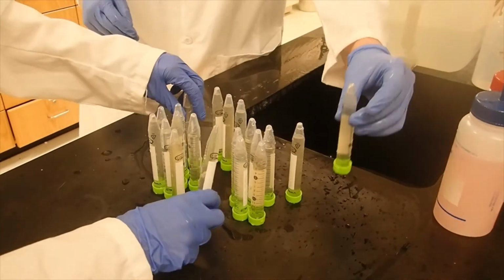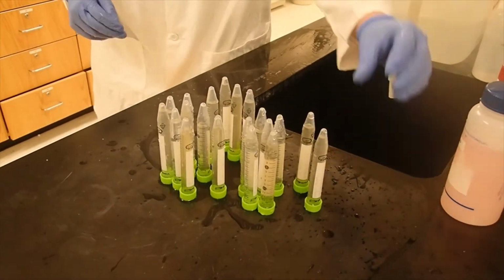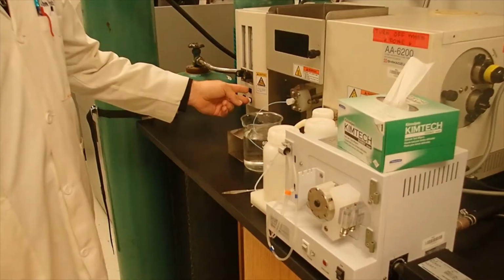That one should be washed off. It was at the bottom. So I just go.